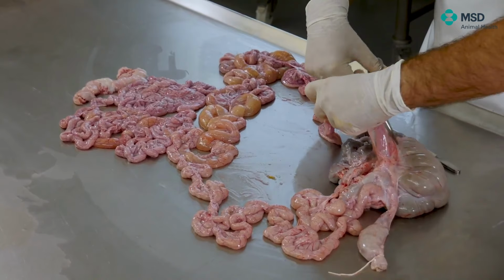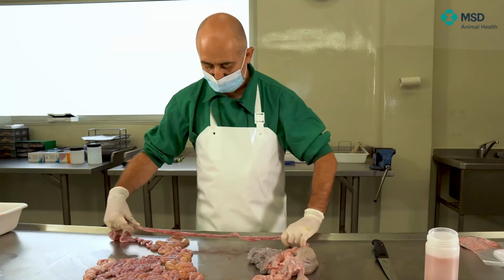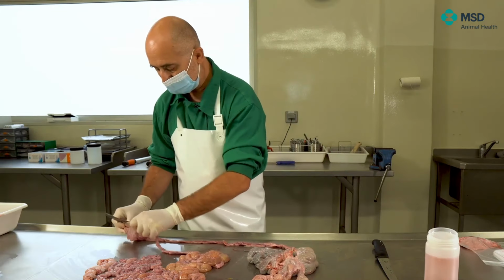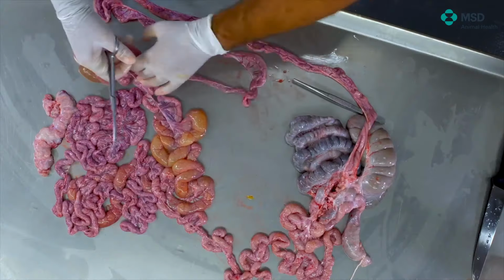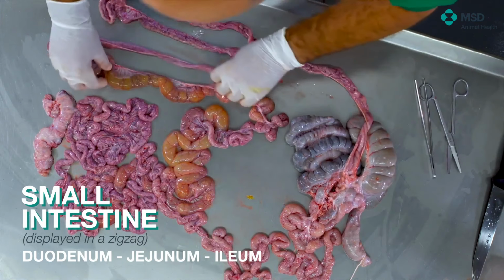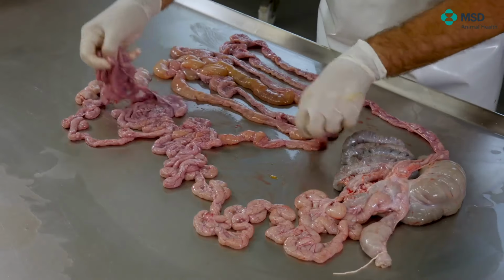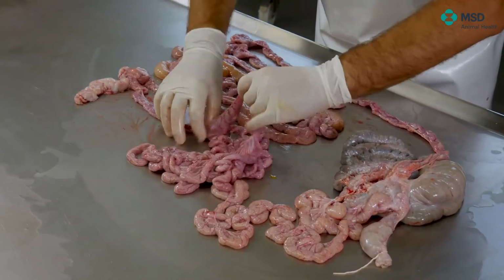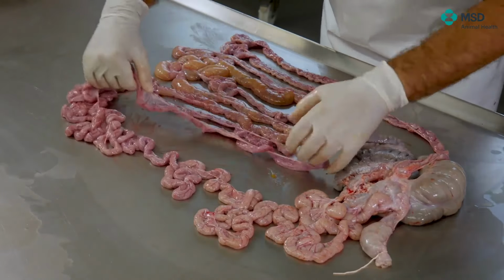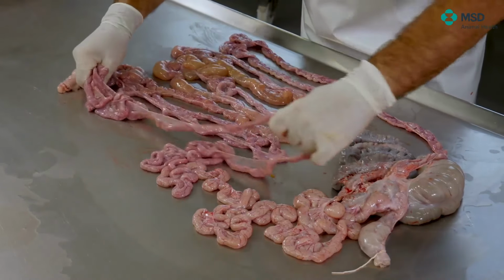And then it would be relatively easy to put the ileum onto the surface of the table or whatever surface you may have. The ileum in pigs is the part where we find the Peyer's patches. So if you are interested in Peyer's patches, it's again lymphoid tissue, again important for diseases like the systemic infection by PCV2, and of course very important as well because it's the place in which porcine intestinal adenomatosis is usually seen. So the Peyer's patch sometimes can be seen grossly through the serosa.